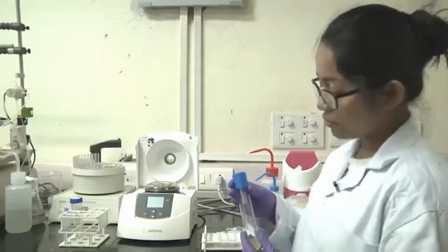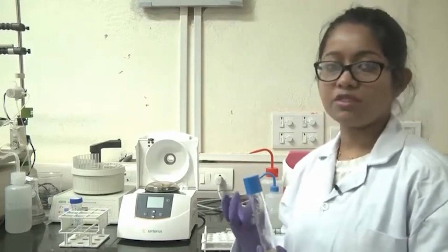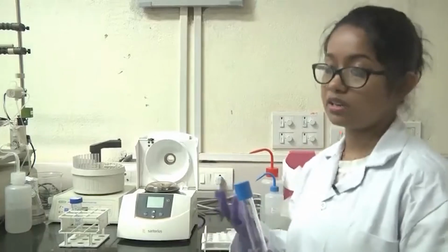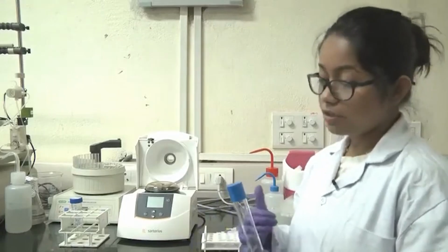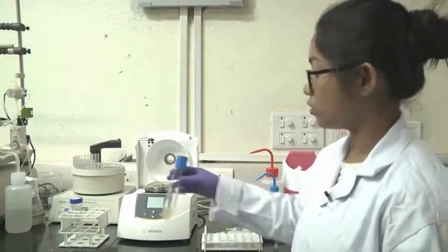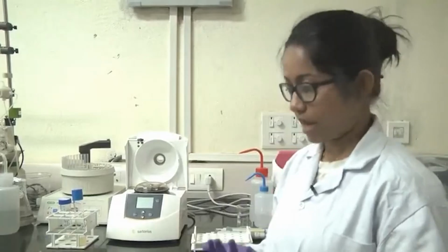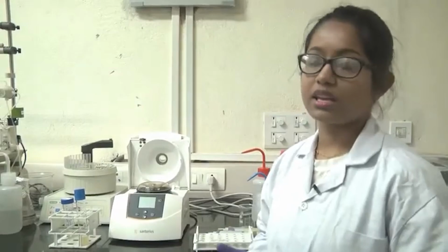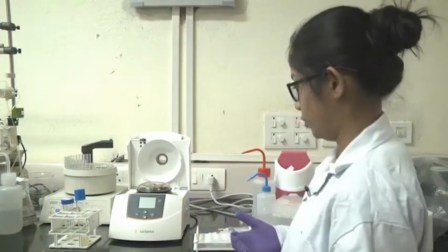Now, today we will use a mini prep kit. Mini prep means basically you can isolate plasmid from 5 to 7 ml of culture media. If you want to isolate more plasmid, from up to 50 ml of culture media, you have to use a midi prep kit. And if you want to isolate from more, like 200 ml or 300 ml of culture media, then you have to use a maxi prep. All these different types of kits are available from different brands, and you can take them, or otherwise you can also follow any molecular biology book and make those solutions, and accordingly you can step up your culture volume.